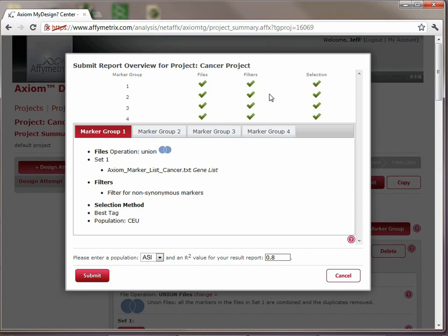So we can see up here that we have green check marks, so we have all the appropriate files and they're in good formats. The filters are selected, and we have selection methods checked for everything.